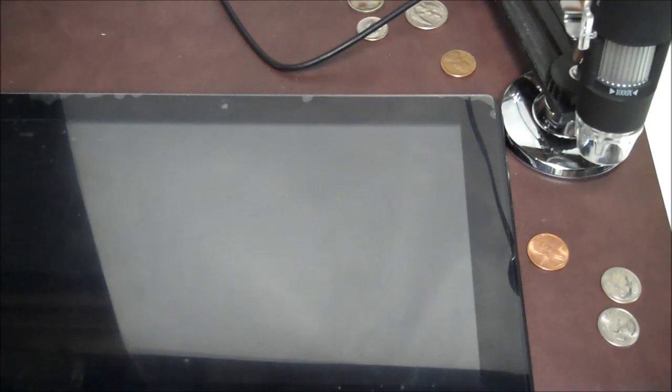Hey y'all, I want to do this new video, explain how to use this USB microscope that I just got and I got to tell you, it's pretty crappy, okay?